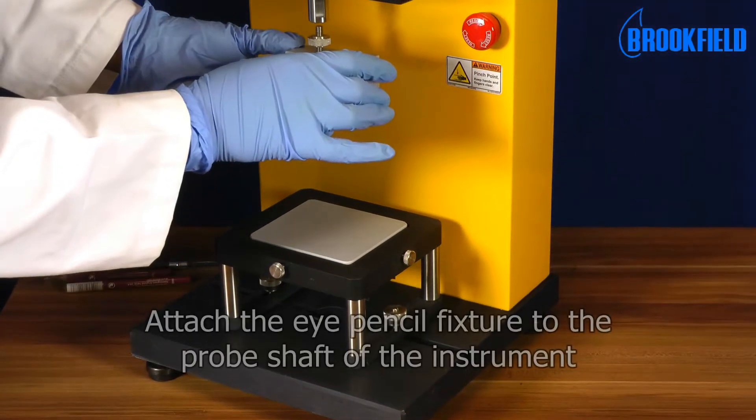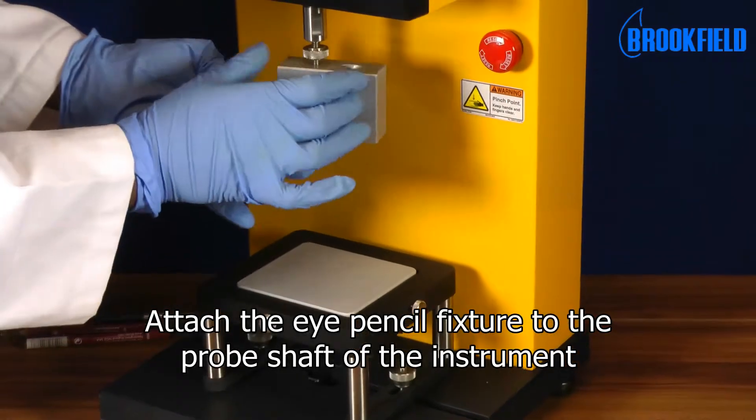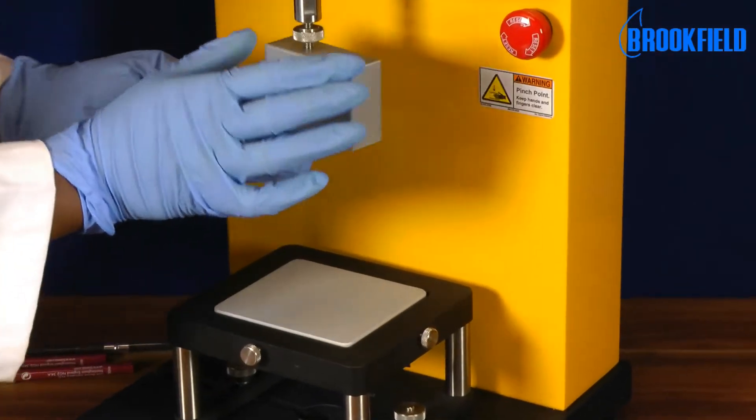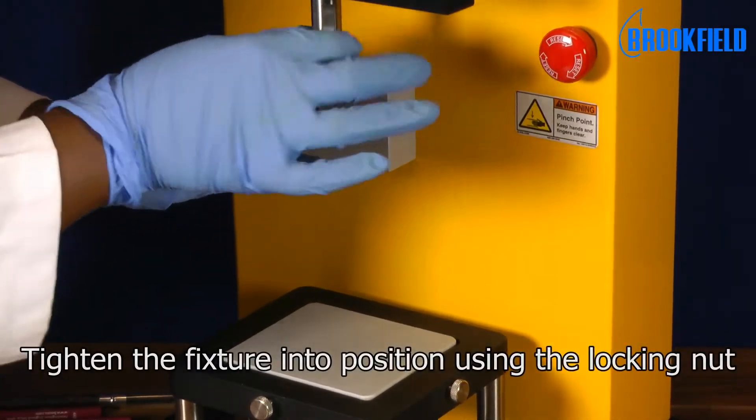To set up the test, attach the eye pencil fixture to the probe shaft of the instrument. Tighten the fixture into position using the locking nut.